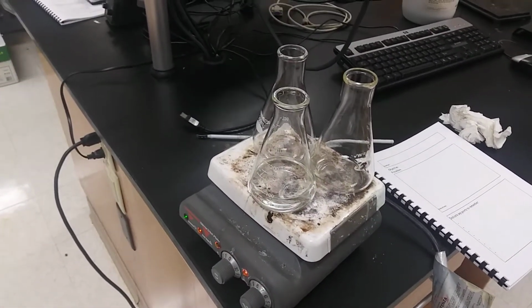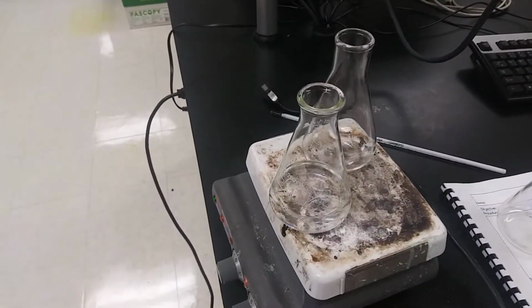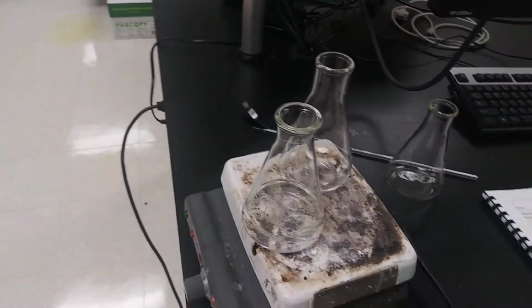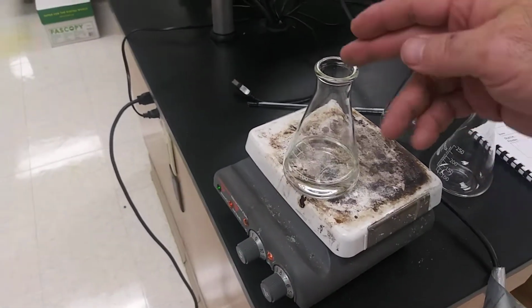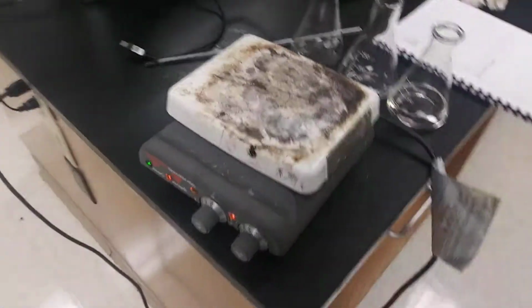If you get to that point and it gets too hot and you're not ready yet, then just take your particular guy off and set him down on the side here. It's not going to affect things too much, and even if it's that warm, you'll see some steam come out the top. You can easily just pick them up and grab them from the top. No big deal.